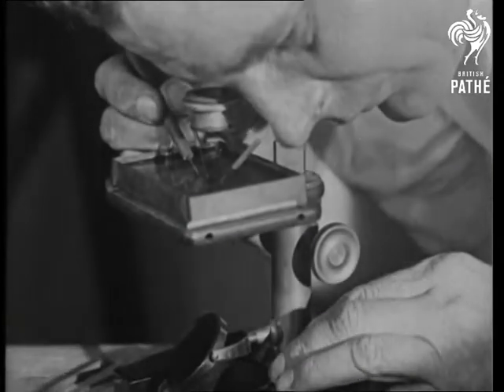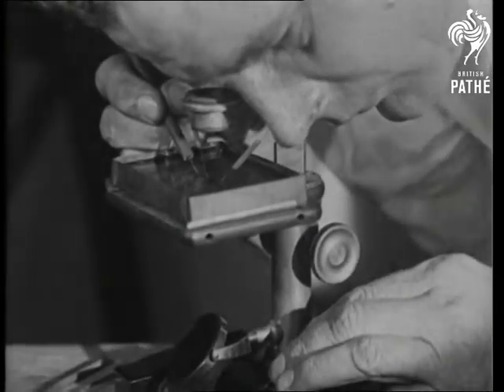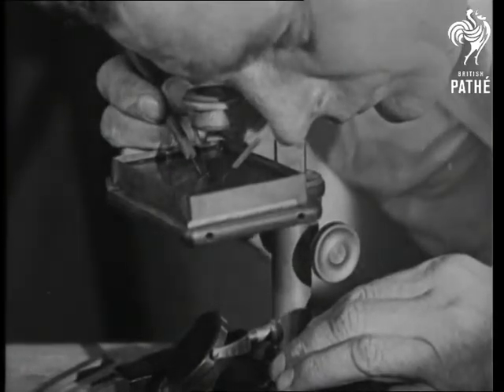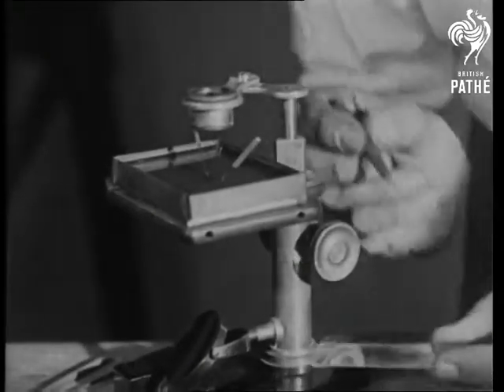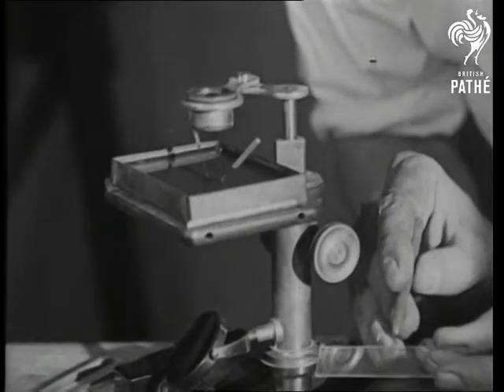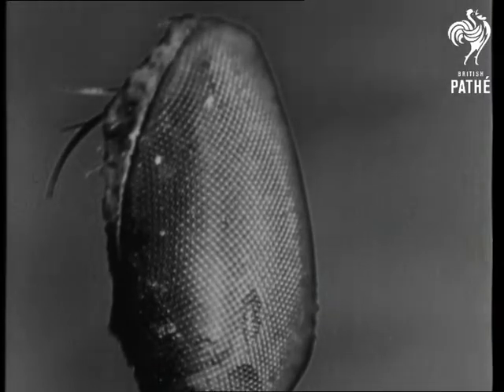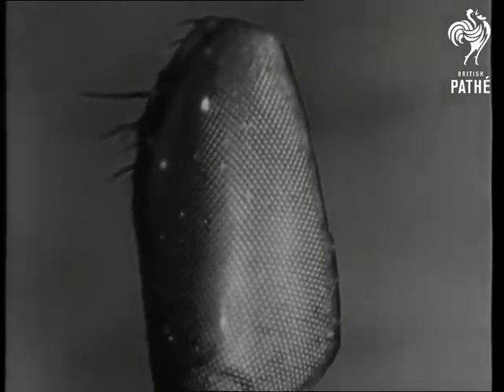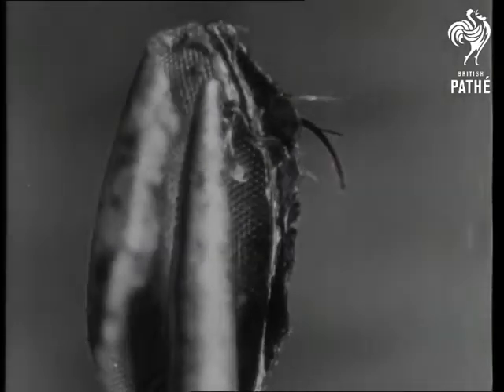Let us now carefully examine under a microscope the miraculous instrument which nature has supplied to the entire insect world. See how it's constructed and how it operates. We take the fly and, highly magnified, we see the multiple lenses clearly, pointing in every direction and covering the entire field of vision.